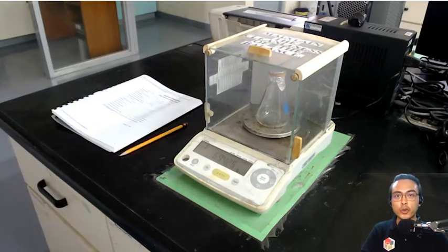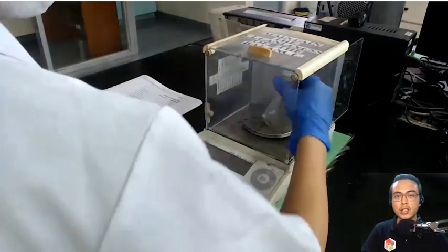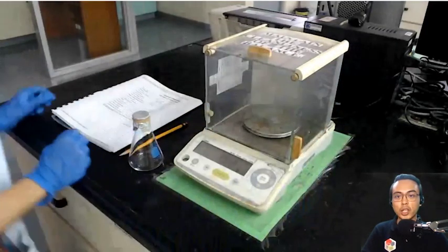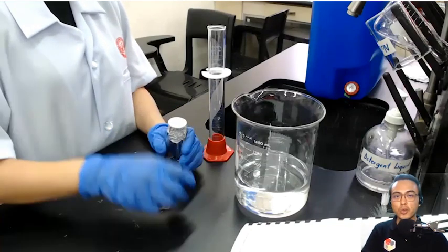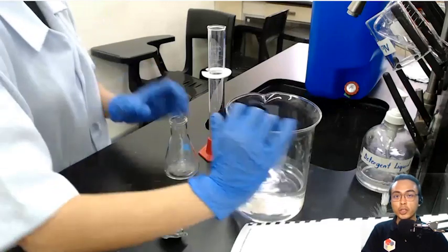Okay? Before doing this, it's very important to make sure that there are no water droplets adhering on the outside of the flask. So the outside of the flask was wiped dry before attempting to weigh it. Now that we know the mass of the vapor inside, we also know the temperature because we measured it earlier.